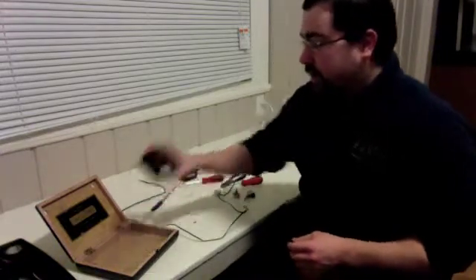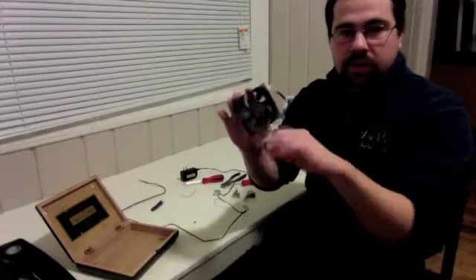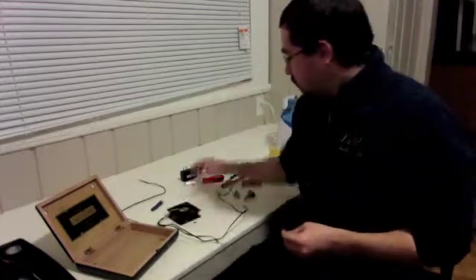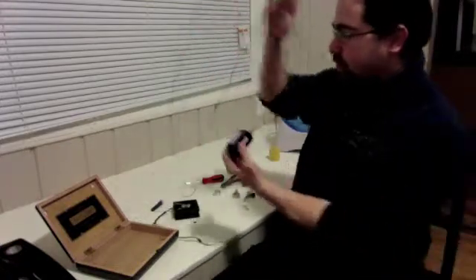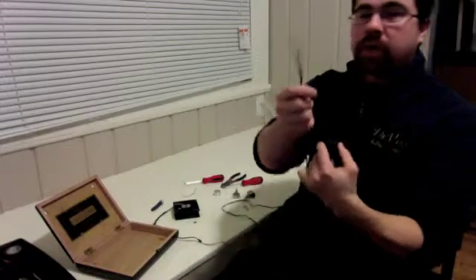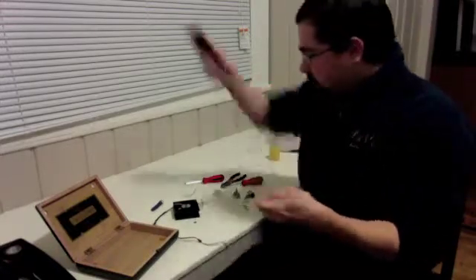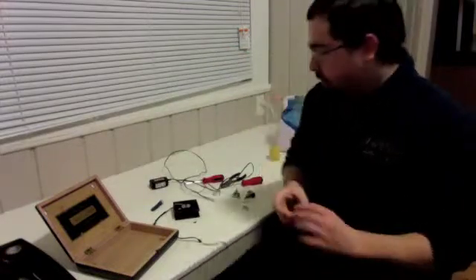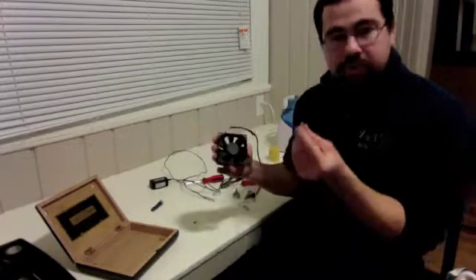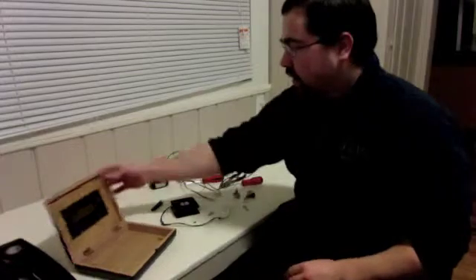But the things that you will need at the very least are going to include an old computer fan, an old phone charger. I just ripped this one from one of my old phone chargers, and you're going to end up cutting off the adapter part, so that's what I got here. I already have the wires stripped. And the last thing is going to be a rare earth magnet. If you're able to scrounge up one of these, you're going to be able to do the same thing with this. And all of that's going to go in some sort of container.